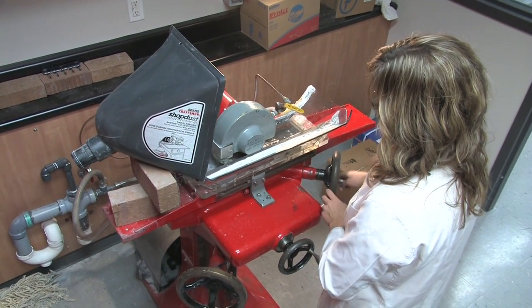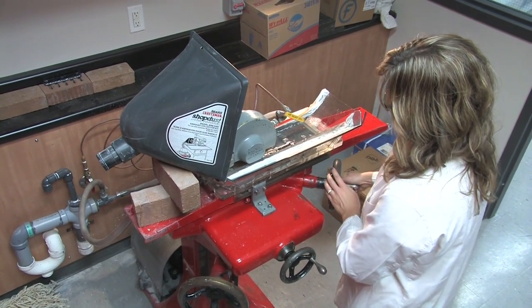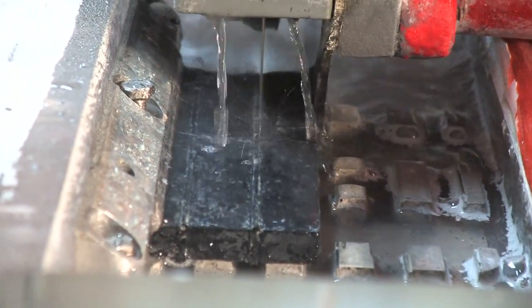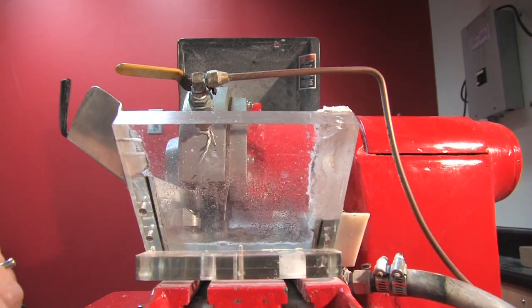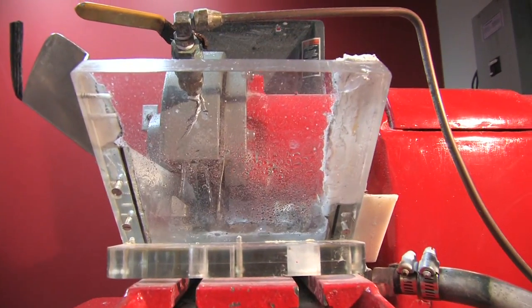We use a modified surface grinder which was modified to include a diamond edge cutting wheel with a mounting bracket, the cutting base, a water outlet, and a splash tray with drainage.